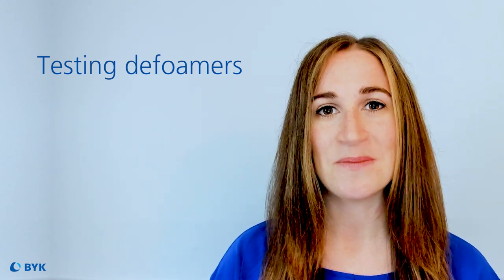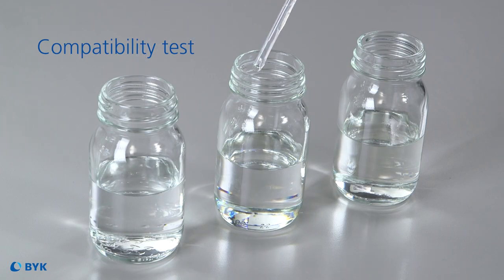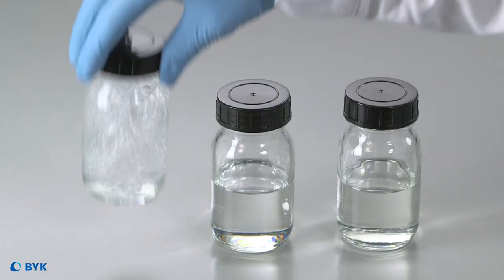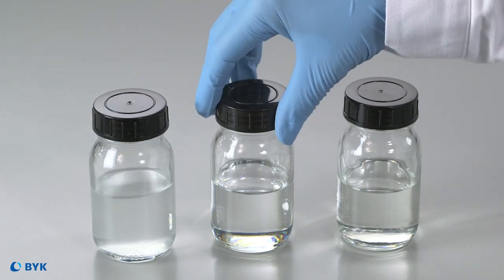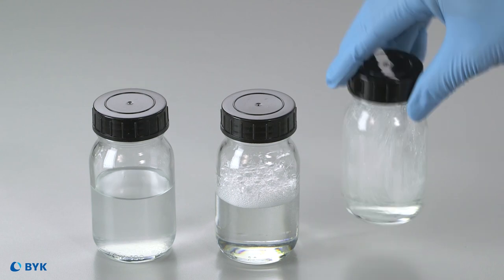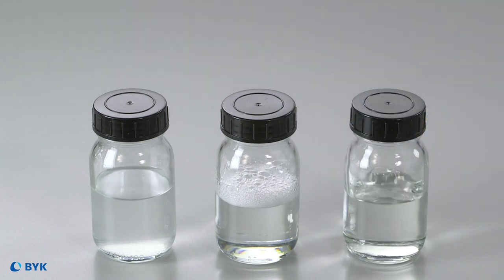Can you guide us through the first test that you will conduct in the lab? We know the defoamer must be compatible enough to not cause extra defects like craters, but incompatible enough to be active and show defoaming properties. This is a quick and easy test to determine if the defoamer will be too incompatible with the system before going through the full set of tests. This is a great start when we have various additives to screen. It can save time prior to evaluation, and it's quick and easy to perform.